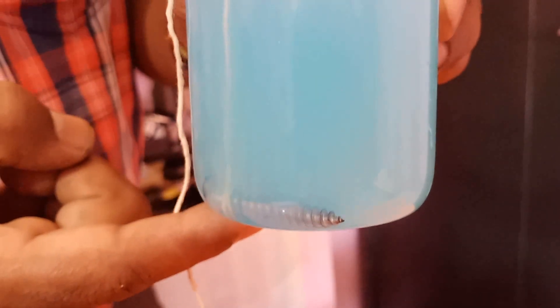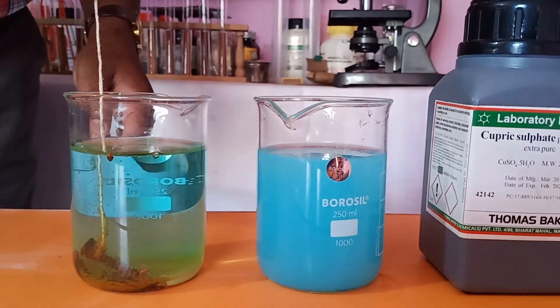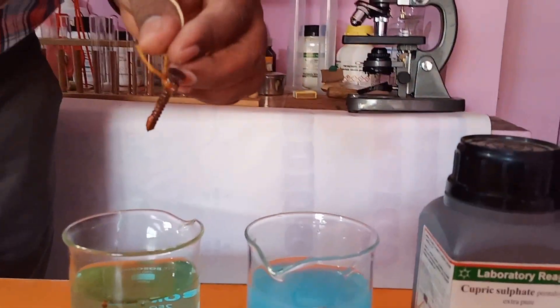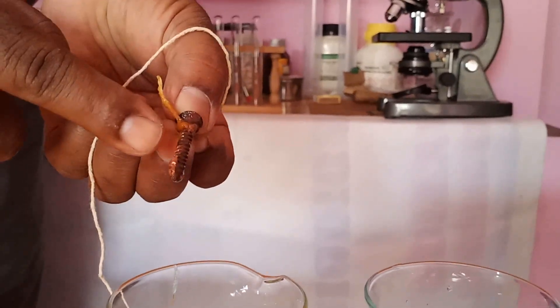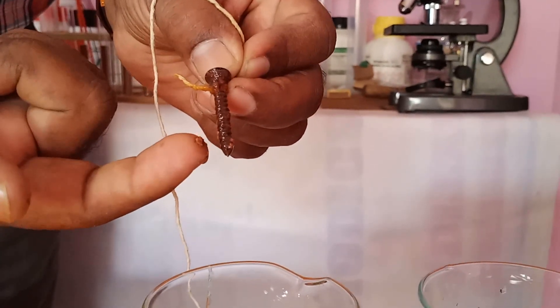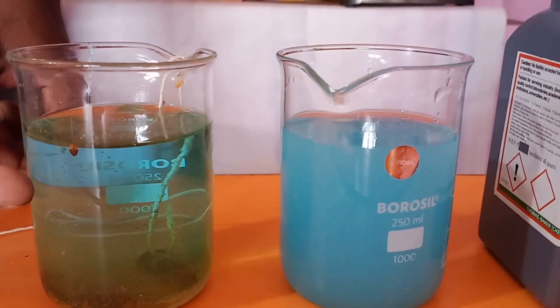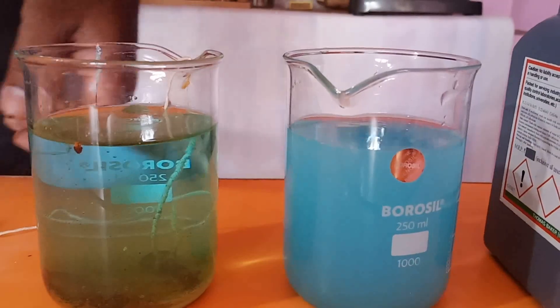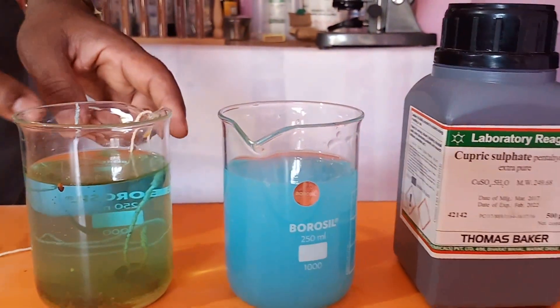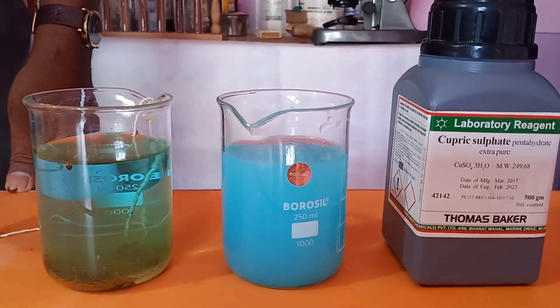After one day, look children — this is the result. See what happened: the iron nail has become brownish, and you see this brownish powder here. The color of the copper sulphate solution has faded. Look at this — this is the original color of copper sulphate. After one day of reaction with the iron, the copper sulphate color faded. This is the displacement reaction where iron displaced copper.